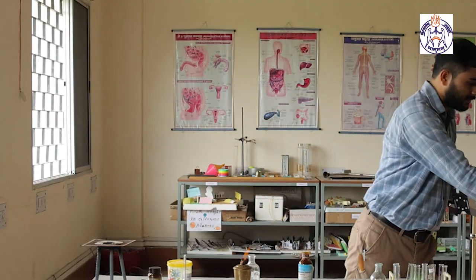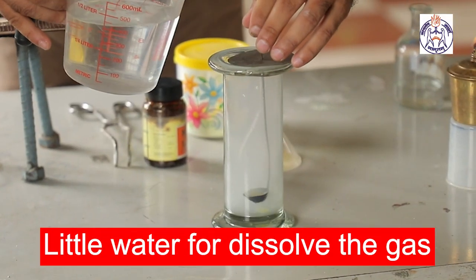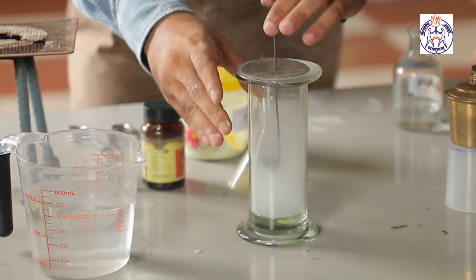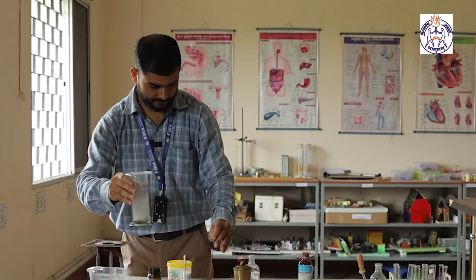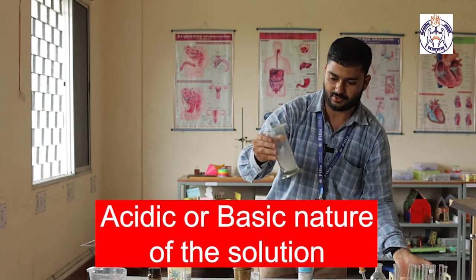Now with a little water, dissolve the gas. And we are going to test the acidic or basic nature of that solution.